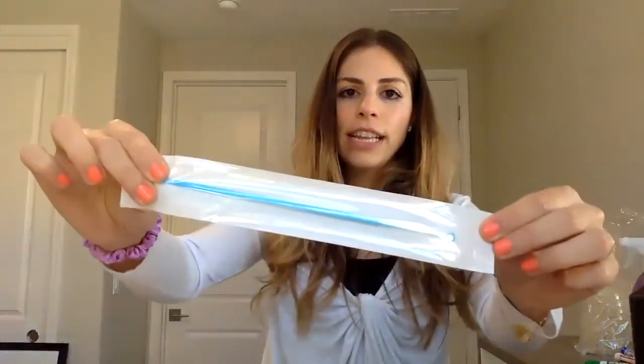So for this experiment, the first thing you need to do, like always, is wash your hands, clean the surface you're going to work on. The things you're going to need: in your lab kit, there's a Ziploc bag, and the Ziploc bag says osmotic pressure. It has 4 nutrient agar plates in it, so take out those 4 nutrient agar plates. You're going to need your subculture of bacteria that you all made. So this is your bacteria growing on an agar slant. And then I want everyone to have 4 inoculating loops. So make sure you have 4 of these because we're going to streak 4 plates. And then finally a Sharpie to label your plates with.